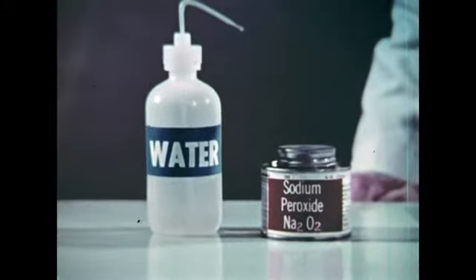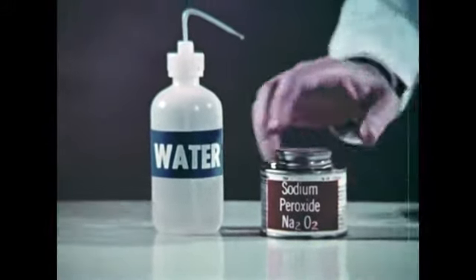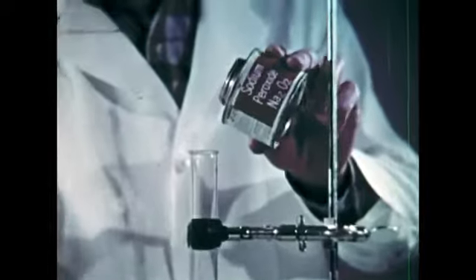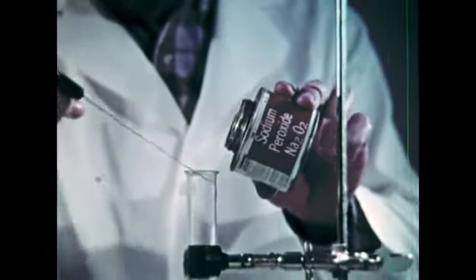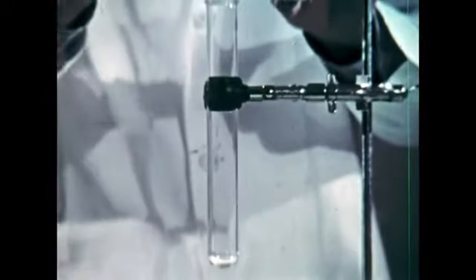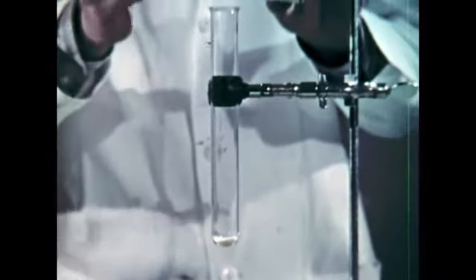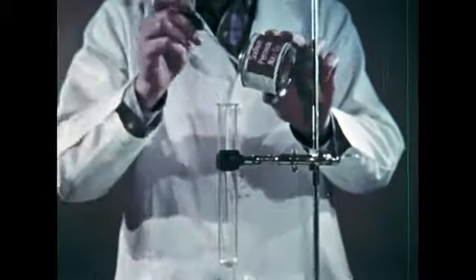When water and sodium peroxide are mixed, they produce hydrogen peroxide initially. However, the reaction also produces a lot of heat, which decomposes the peroxide as fast as it is formed, releasing oxygen. The preparation of stable but energy-rich compounds, like sodium peroxide, is one of the general ways of capturing oxygen for later use. A number of these are convenient sources of oxygen in the laboratory.